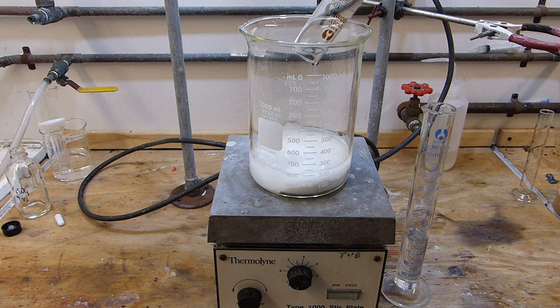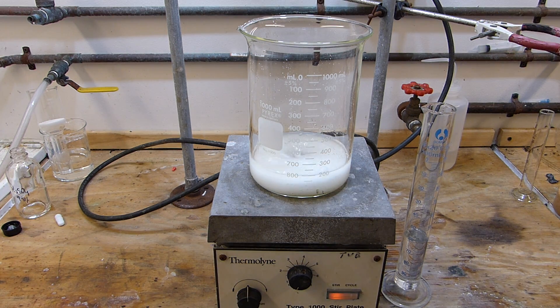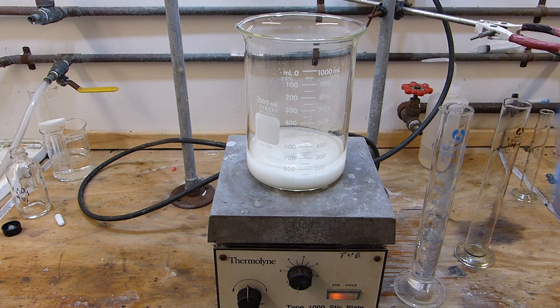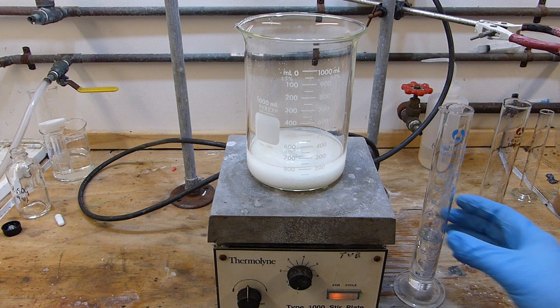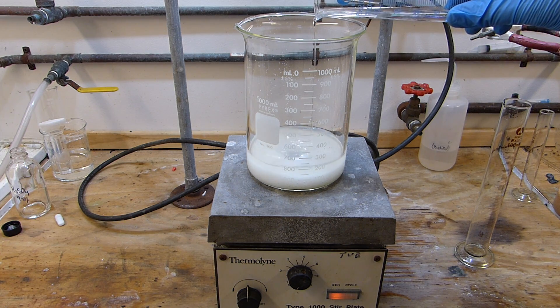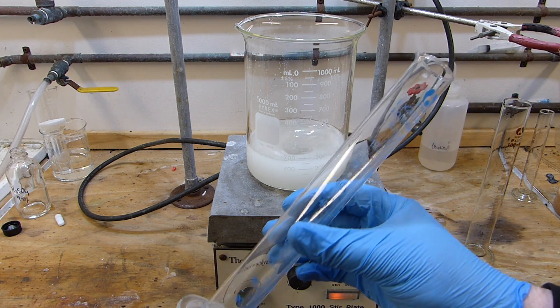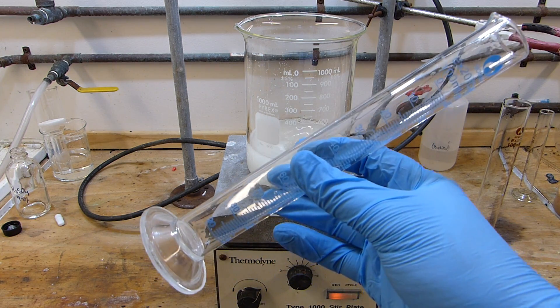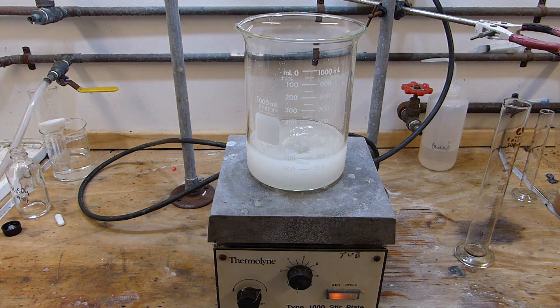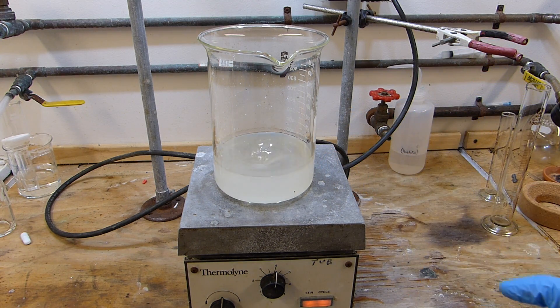So the methanol can go in quickly, get the stirring going. Then very slowly the sulfuric acid, and I'm going to turn on the fume hood for this because it's going to get warm and some methanol will start to vaporize. You always want to make sure that you wash out the sulfuric acid containing graduated cylinder very quickly after you use it, because it looks just like water until you touch it and then you know for sure it actually was concentrated sulfuric. So it's best to just wash it rather than leave it hanging around. So what we have stirring here is a solution — a whirlwind of crystals of dimethyl oxalate and oxalic acid stirring around in a solution of methanol and sulfuric acid.